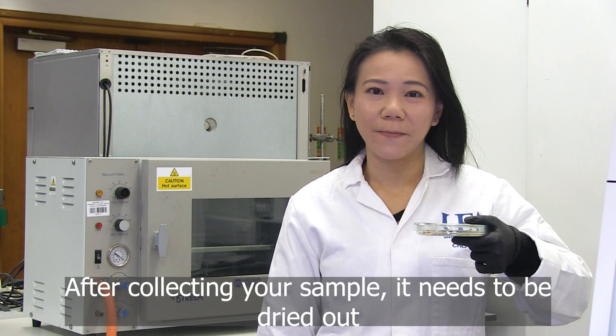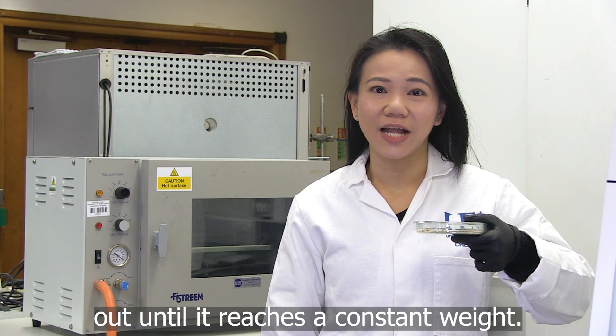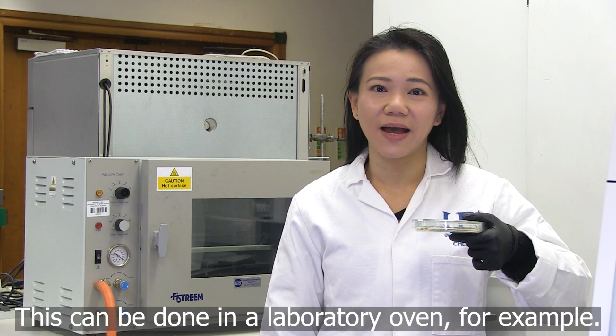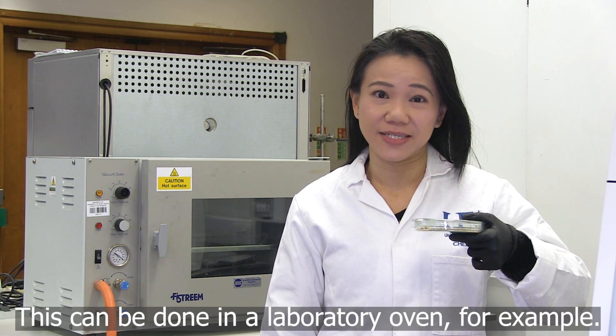After collecting your sample, it needs to be dried out until it reaches a constant weight. This can be done in a laboratory oven, for example.